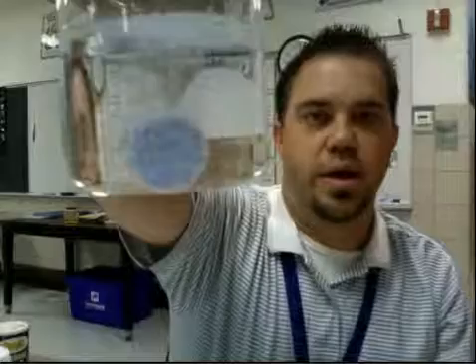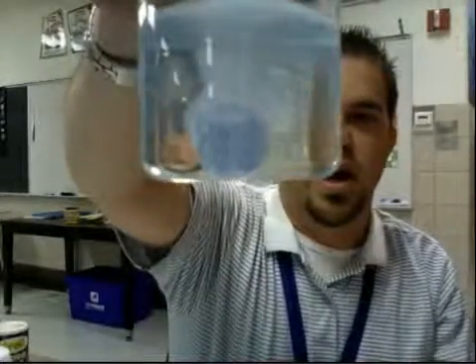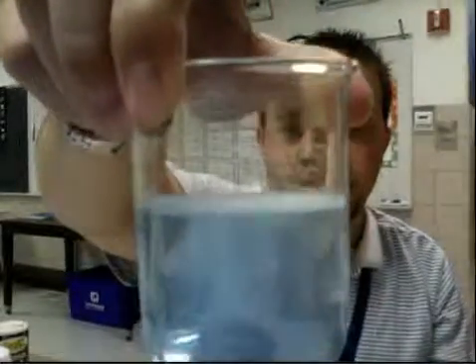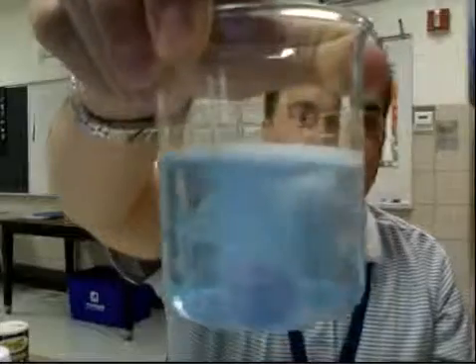Number 9 is an Alka-Seltzer tablet. I have the Alka-Seltzer tablet here and a beaker of water. I'm going to drop it in. You can see what's happening. Notice that it's starting to react, and there are bubbles coming from the Alka-Seltzer tablet going into the water. Notice the foam, or the bubbles, at the top. Notice the color change in the water. So that is number 9.